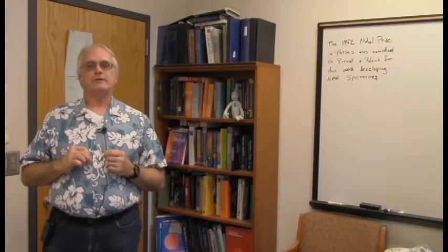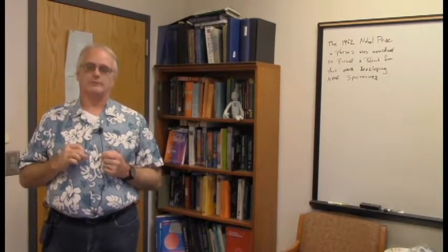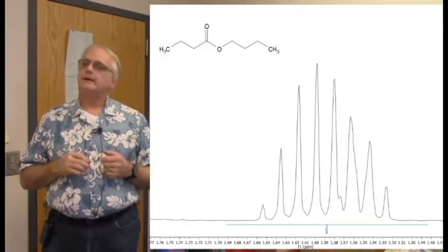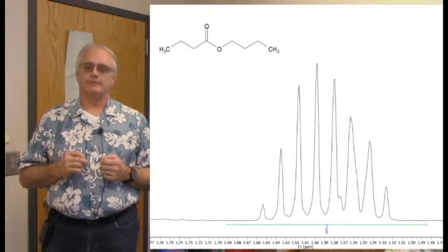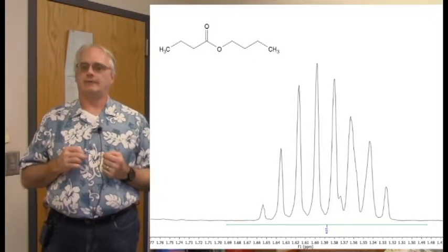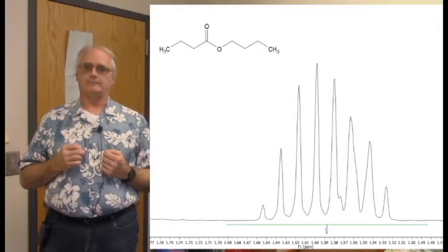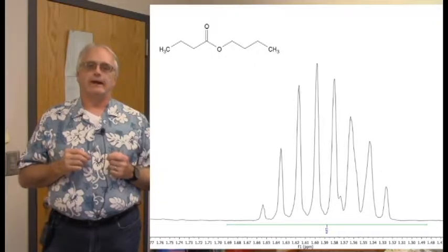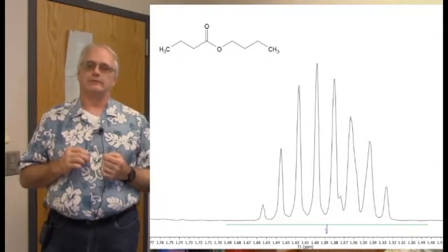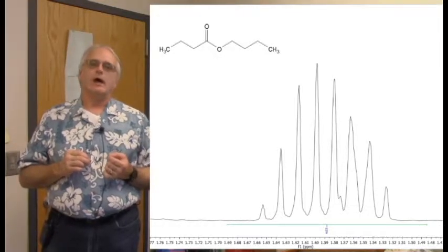But as we look at this spectrum, sure enough, we come to this group in the proton spectrum. It integrates to 4, and with knowing the structure of butyl butyrate, we're pretty certain this is 2 overlapped methylene groups. And indeed it is. The fact that it integrates to 4 is a strong indication that it is 2 methylene groups overlapped. And sure, we know what the structure of the molecule is.